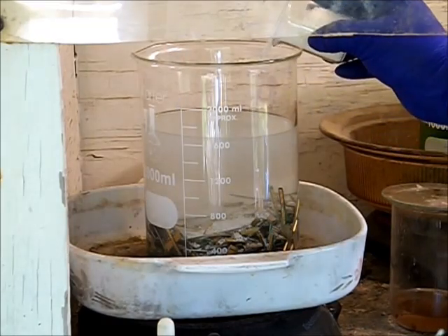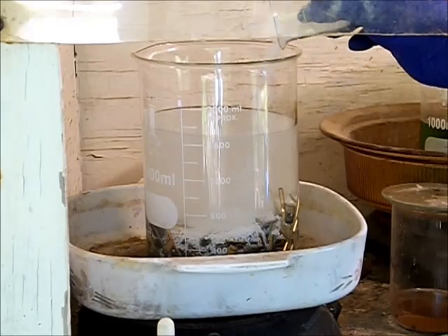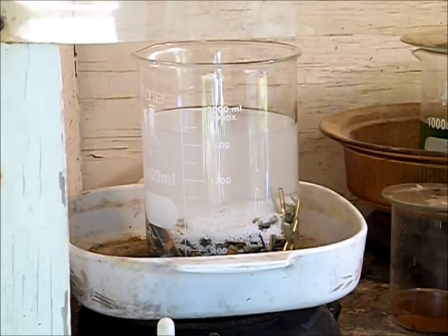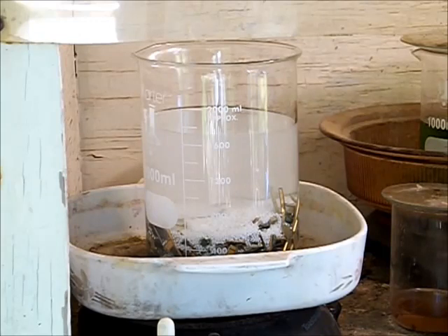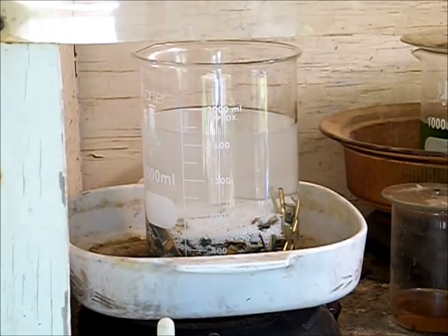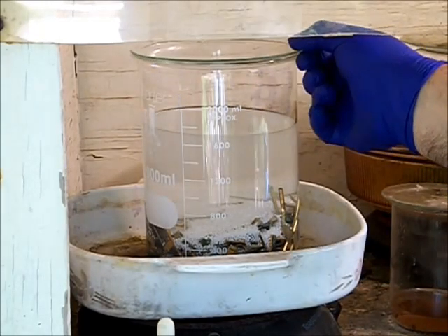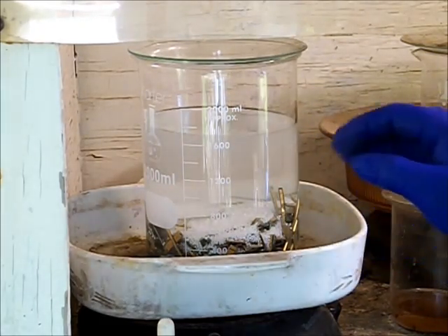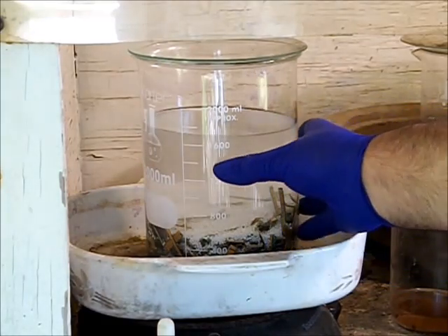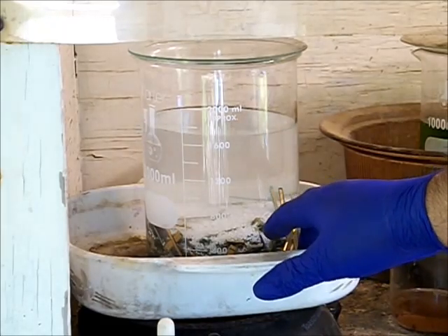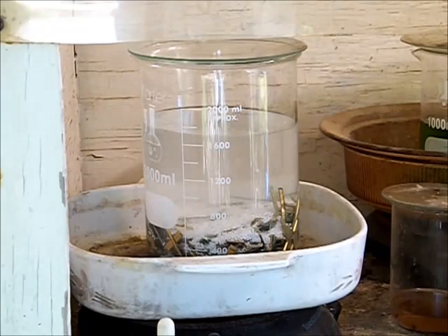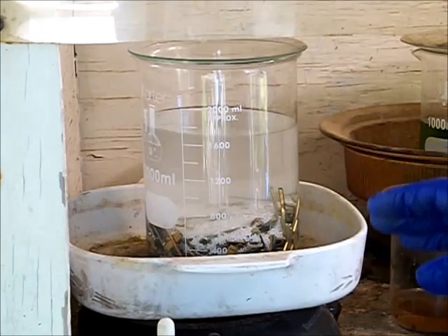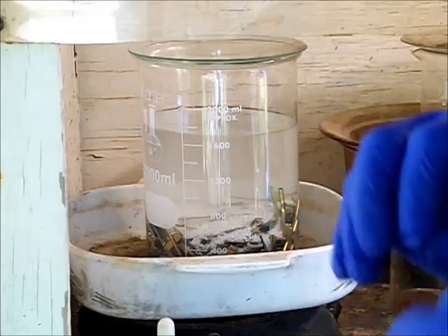At this point nothing is actually happening because it has to get hot. Now we're going to put our watch cover on. Our heat's on, our chemicals have been added, the nitrate is dissolving, and we'll start seeing a reaction here in a few minutes.